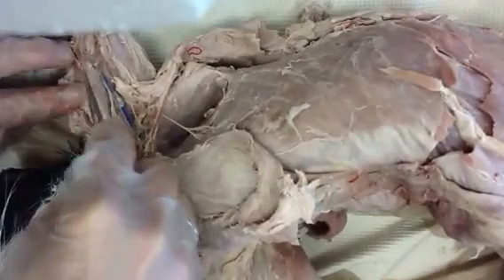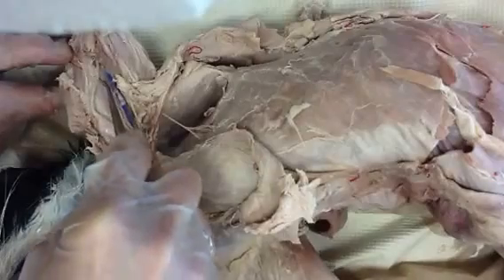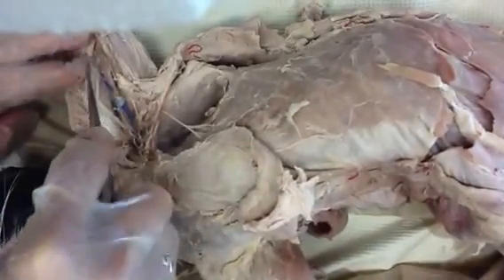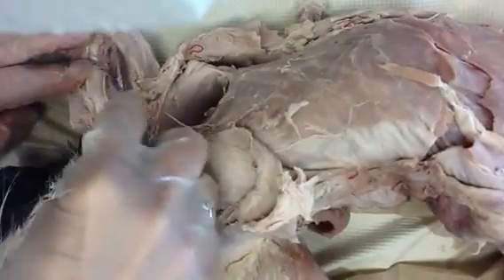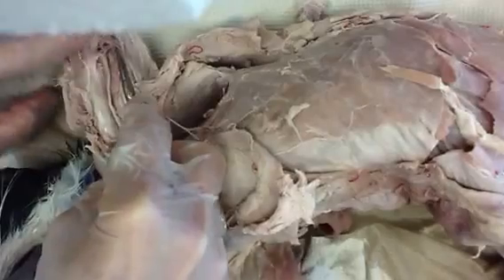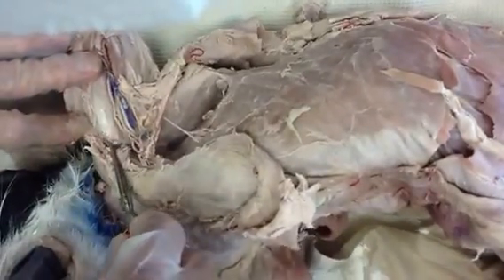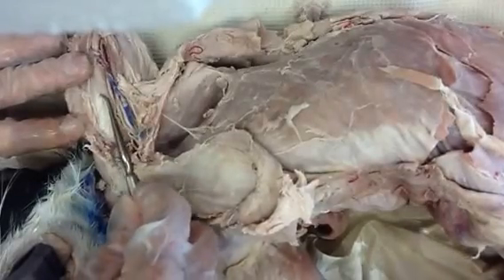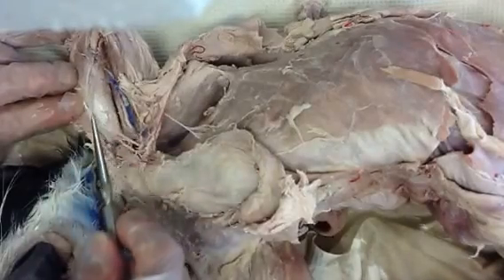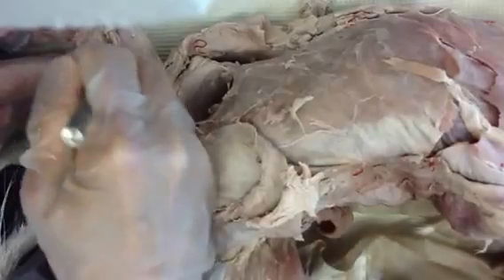When you get close to joints, it becomes difficult to tell the nerves from the tendons because they are all wrapped in the same kind of dense regular connective tissue which appears white and they're really tough like tendons are too. So sometimes we get down into a joint and it's hard to tell the tendon from the nerve. But — they're not shiny. That's true.